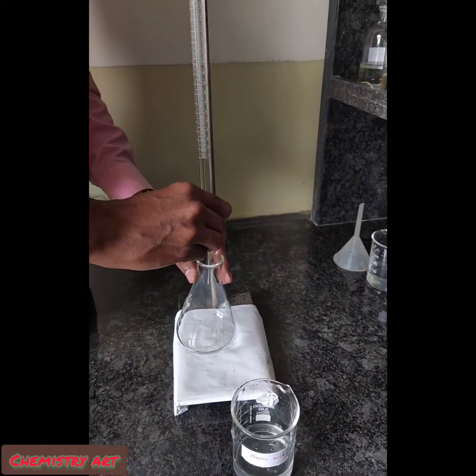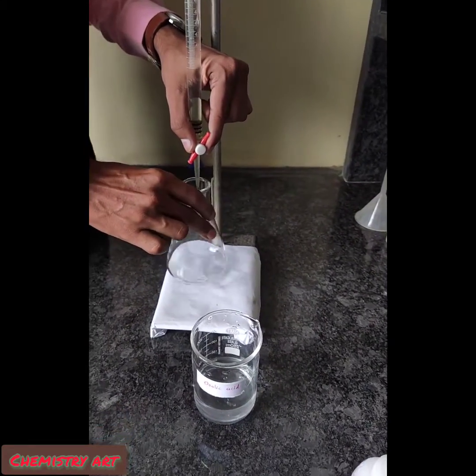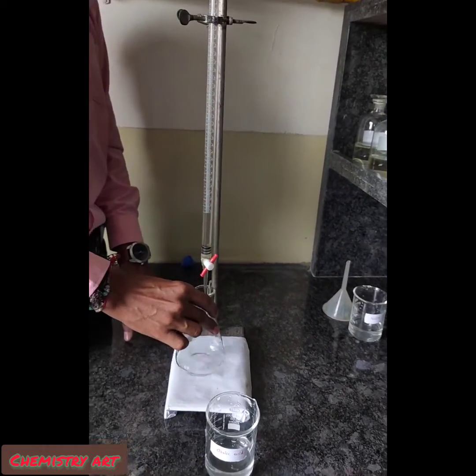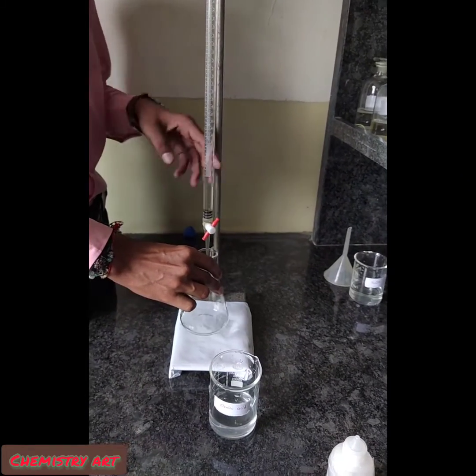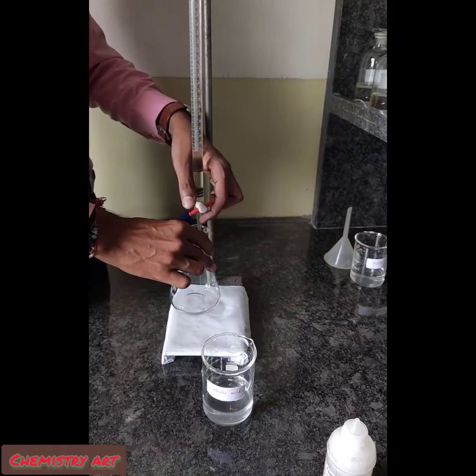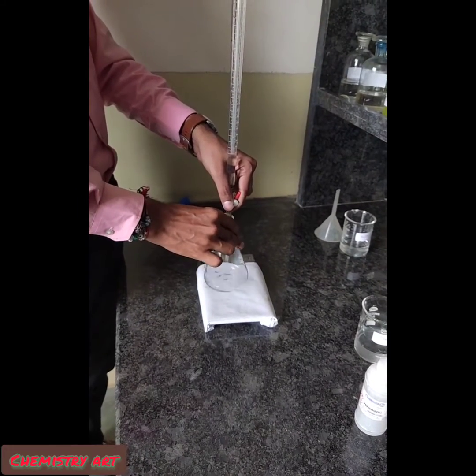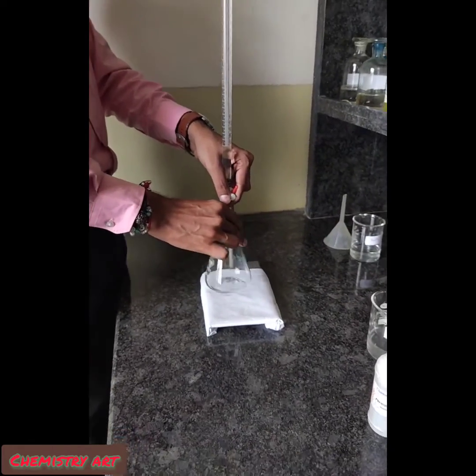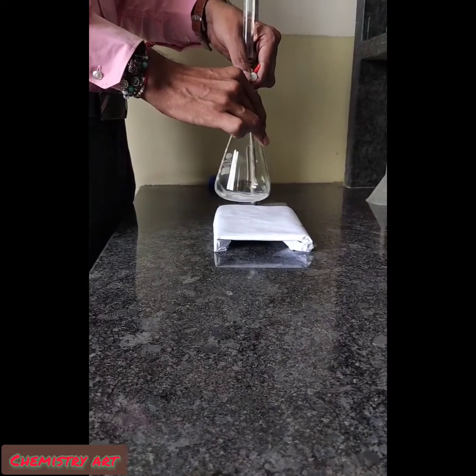Start addition very slowly and stir the conical flask continuously. You can use a white background to clearly see the color change. You can see that when a drop falls in, it gives a pink color but it immediately disappears. Continue adding dropwise until a constant, stable light pink color appears.